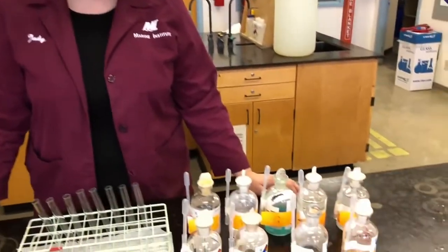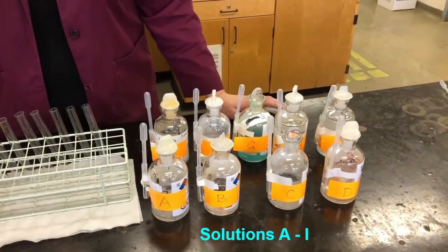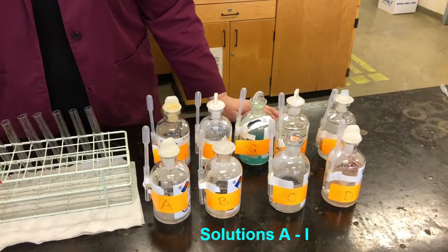For example, if your observation is that there are bubbles produced in the test tube, we can deduce based on that that the substance reacted to produce a gas. So we're going to look at observations and deductions. Today we're going to do 8 different experiments to see if there's a reaction being produced or not by looking at our observations. We have a number of different solutions here, and they're all labeled with letters. Of course we don't know what they are because they're unknown solutions.